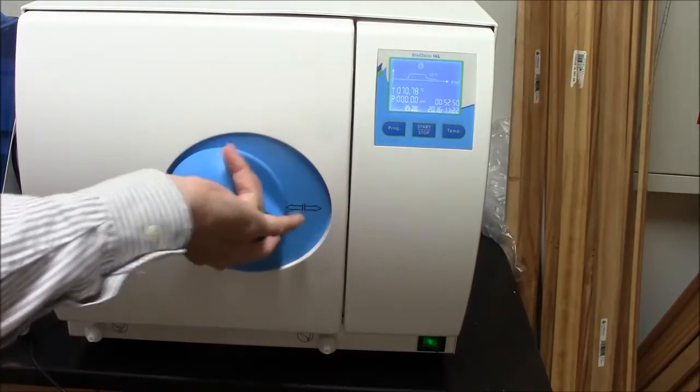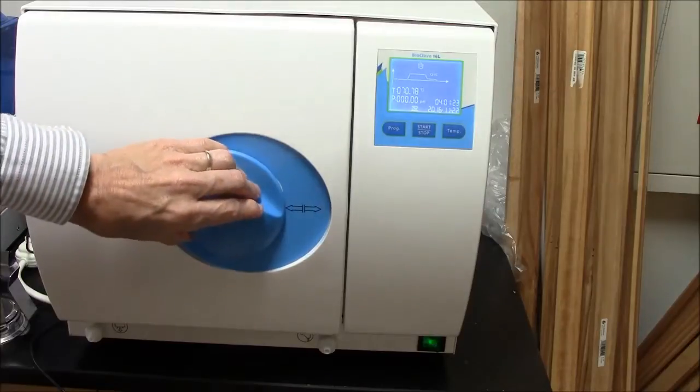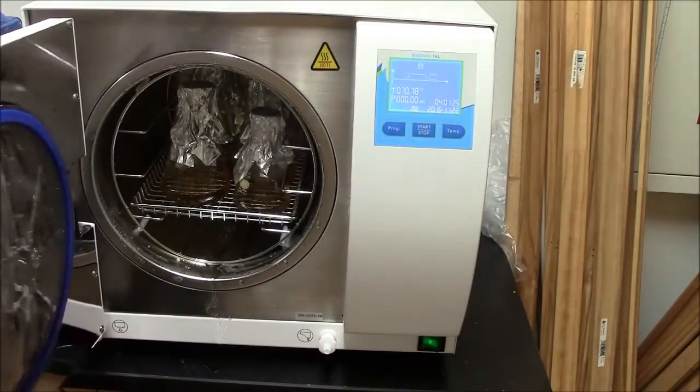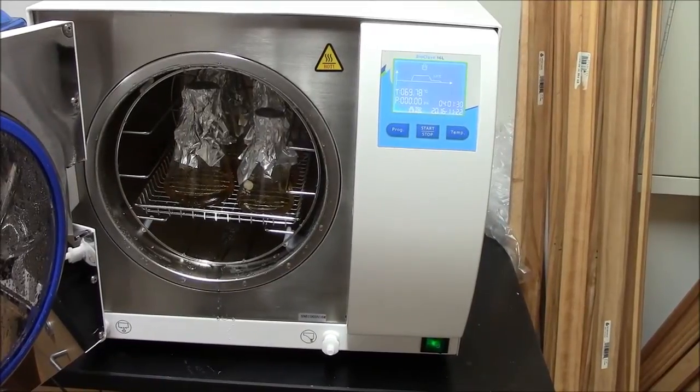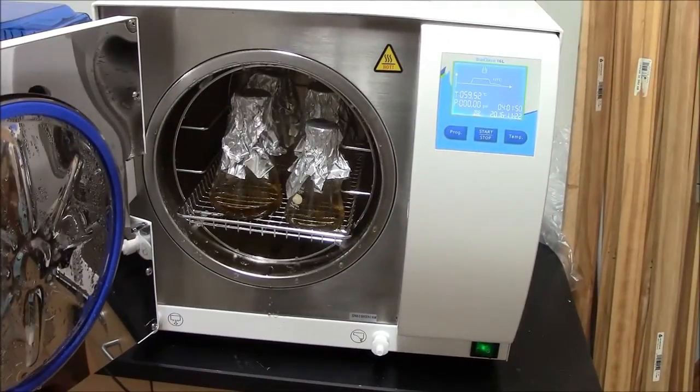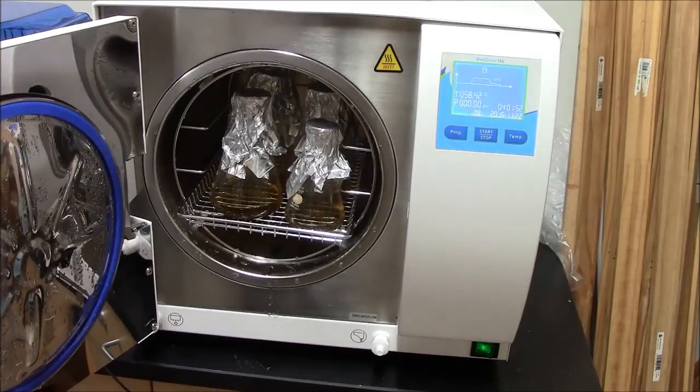So I'm going to open the door and there's my sterilized media. It's a little smelly but not bad. This is wonderful.